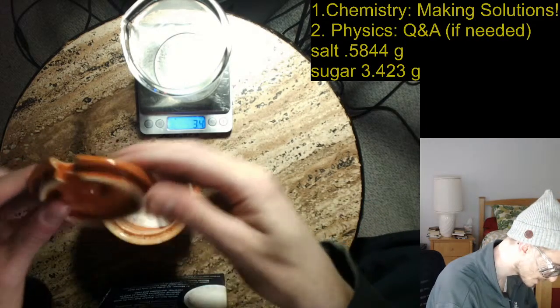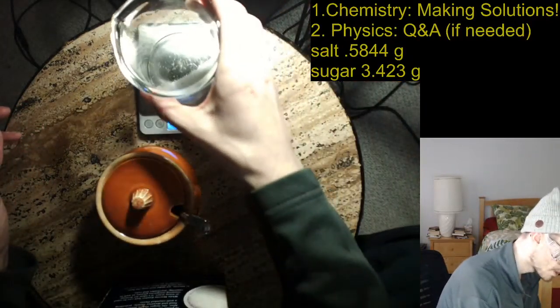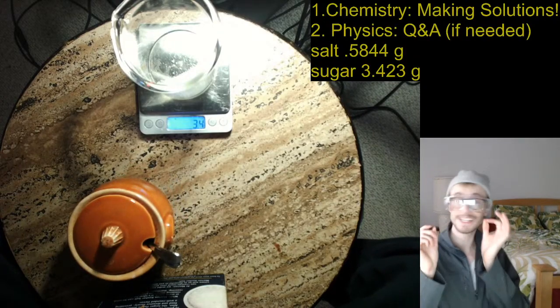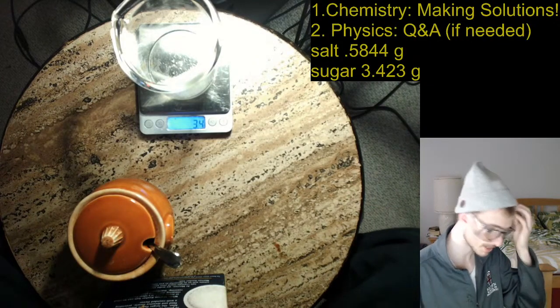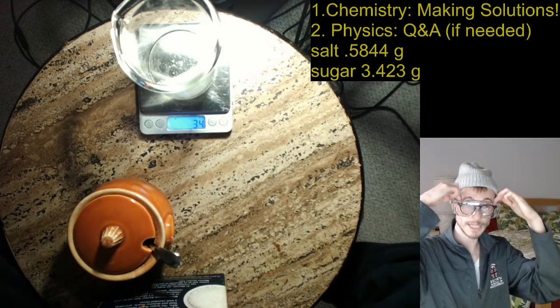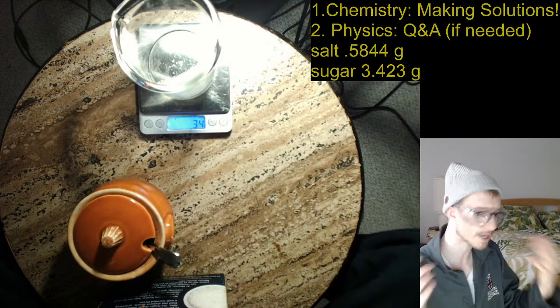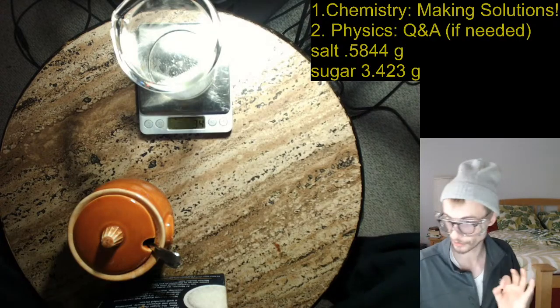So notice that I added a significant amount more sugar than I did salt. That's really important because what's tricky about the whole situation is that the masses are going to be significantly different even though I want the same amount of each molecule. So this is really where the molar mass comes in handy. Your average kitchen chef isn't really thinking about this. We tend to measure things by mass and just use that as an approximation for how many molecules there are. But if we really care about having exactly the right 1-to-1 ratio, that's what we've got to do.